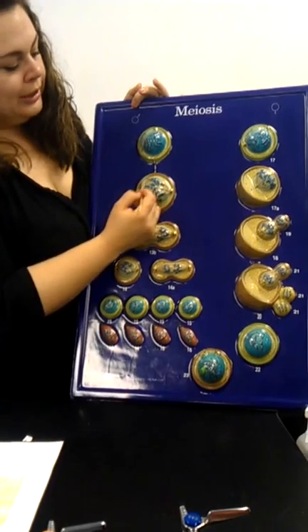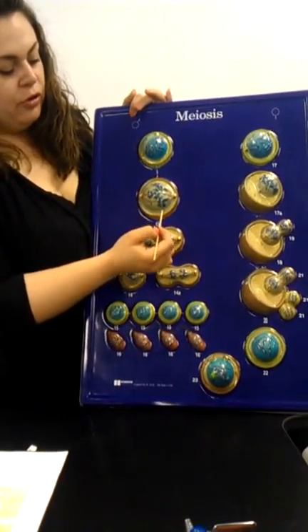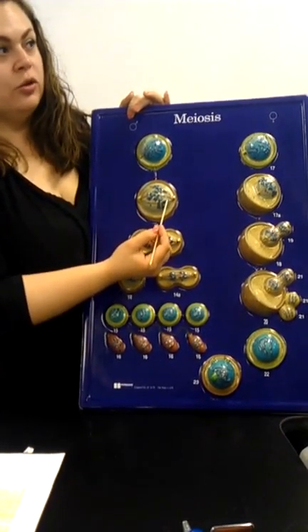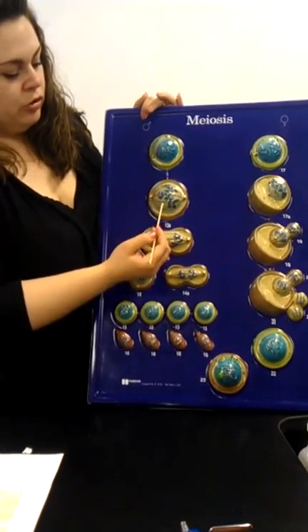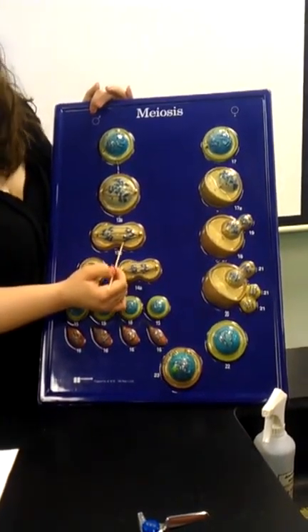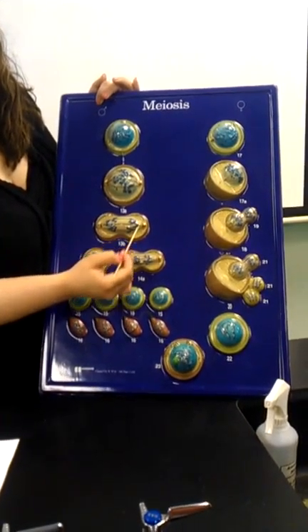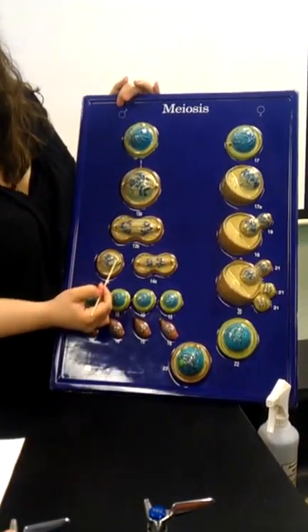Okay, and 13A, this is now early metaphase. Now, in the exam, if you have to differentiate between early, late, whatever, you do need to know those steps, okay? So make sure everybody takes a picture of this and really knows it. Okay, then B, this is anaphase, right? So the chromatids are going to opposite poles. Okay, you start to see the cleavage furrow.